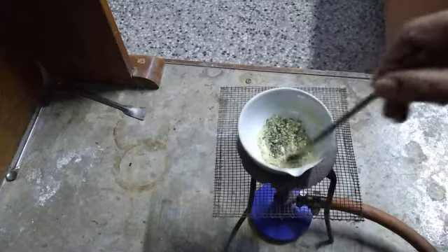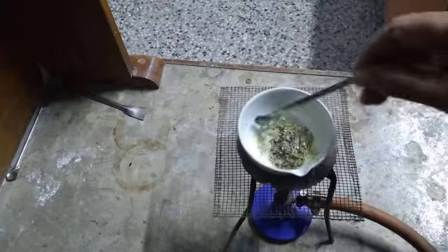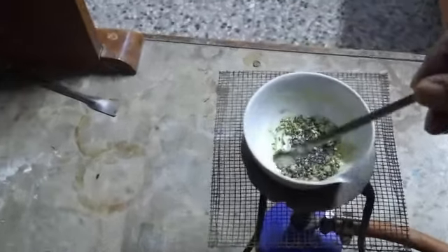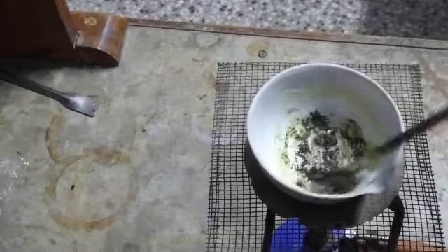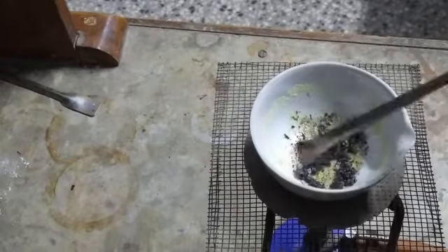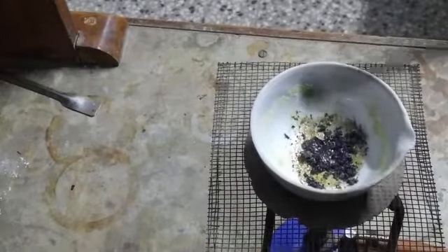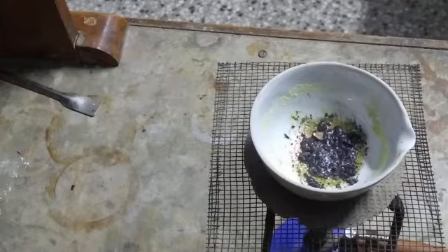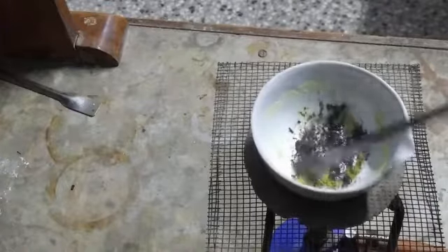Initially it is having a heterogeneous character. Now it will be converted into homogeneous slowly and slowly. See the homogeneous nature — the reaction is taking place. See the change in color. Now initially it was heterogeneous, but due to the reaction, you can see the bubbles — it means a chemical reaction is going on. See the formation of bubbles by heating, and see the heterogeneous has been converted into homogeneous.